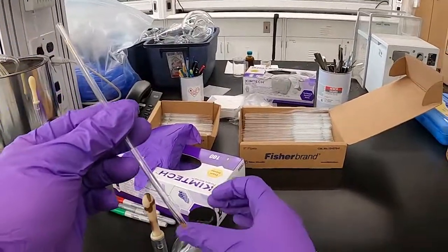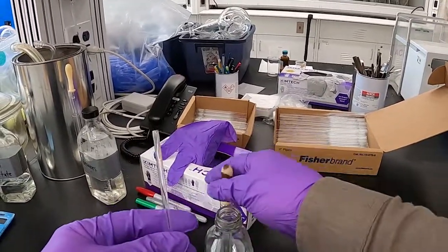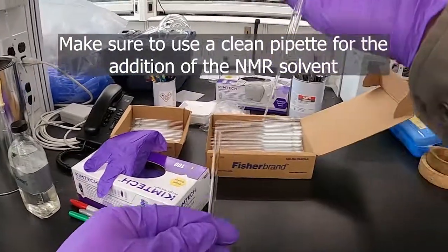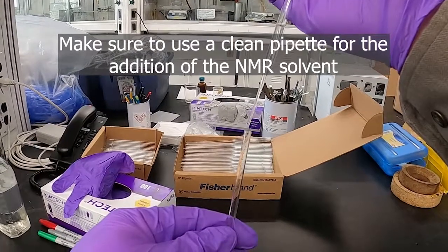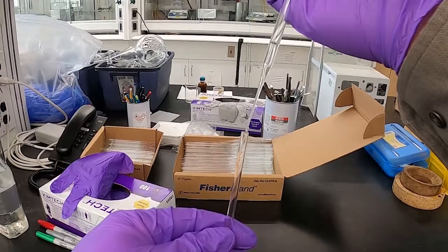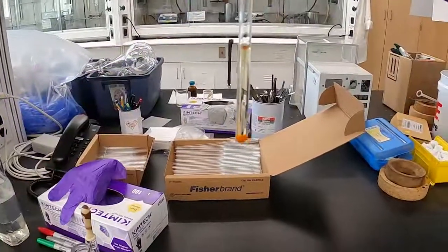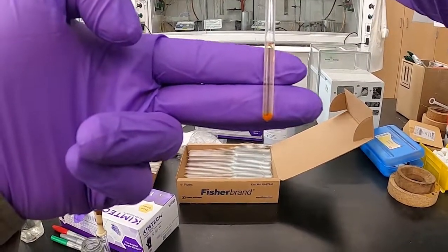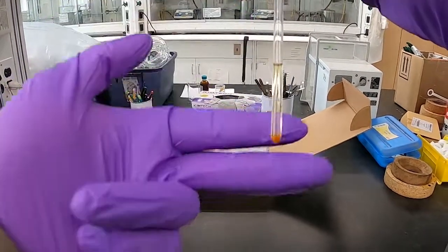Add solvent to this — going about an inch worth, or about two finger thicknesses. I'll drip some in here until I get about the right amount. About that much — you can see that's about two fingers, or probably a little over an inch, an inch and a quarter.